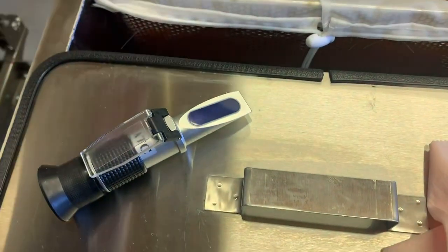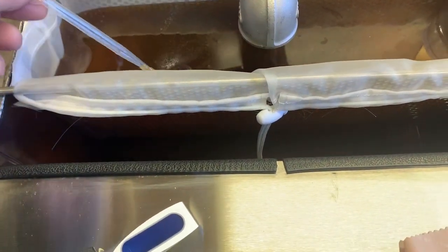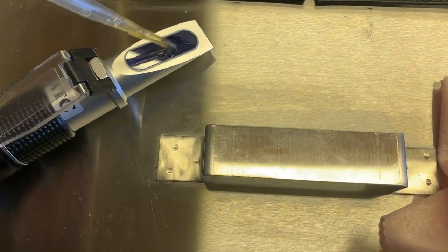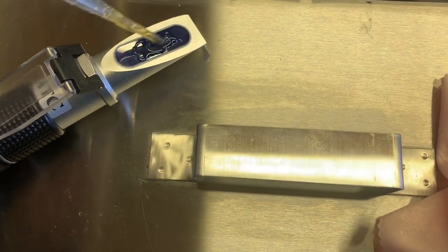You're then going to pull some honey out of your batch. You only need a couple drops, and you're going to put that on the surface and spread it on the blue area.